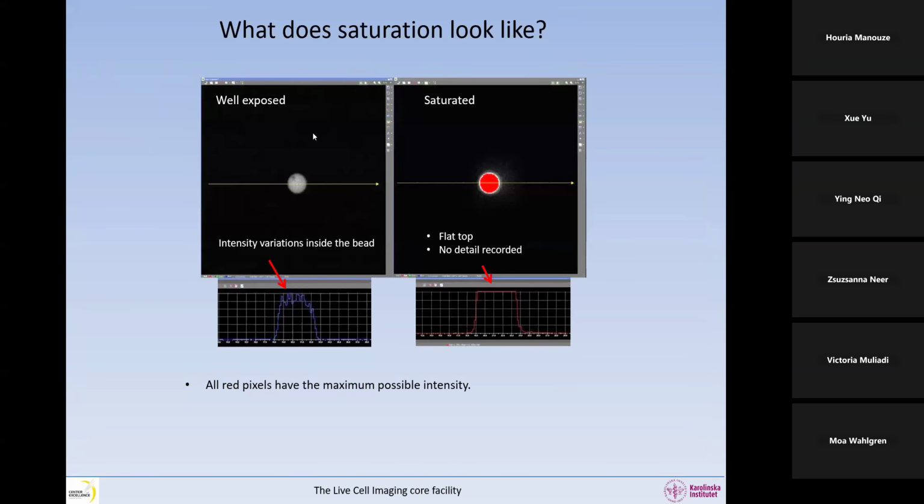So what does saturation look like if we have a fluorescent bead that is well exposed, and we draw a line in the middle and we look at the intensity profile? What we can see is that this is outside of the bead. Here we go inside the bead, we have the edge of the bead. Because it's fluorescence and it's microscopy, even though the edge in our sample is very sharp, just outside the bead, inside the bead, very clear, in microscopy, because we lose contrast, we have a softer edge. And if we look at the top here, we can see it's all jagged. So there is definitely some sort of texture in the image. You can see differences from one pixel to another in this image that is well exposed.